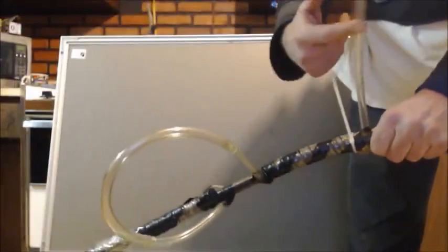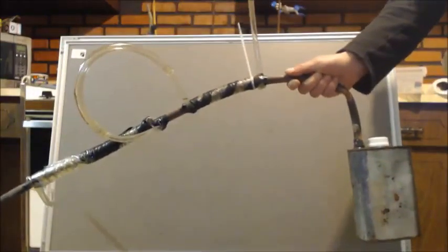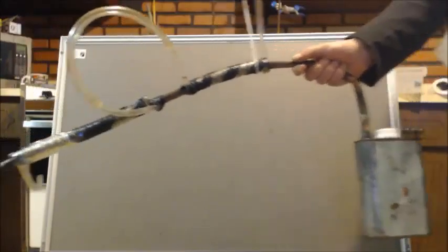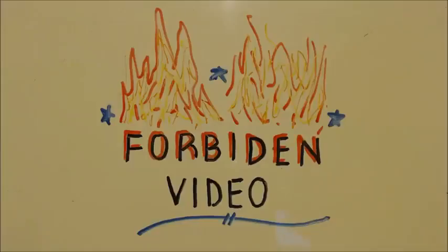But I do have, here's the can. So I have the condenser from here. Here's my in or out, all the way down to here. And then it comes out here. So that's what it would look like with a water-cooled condenser. But remember, this is a novelty type thing, you know what I mean? Even in the video, I only distilled water with it. You know what I'm saying? And always remember, science is great.